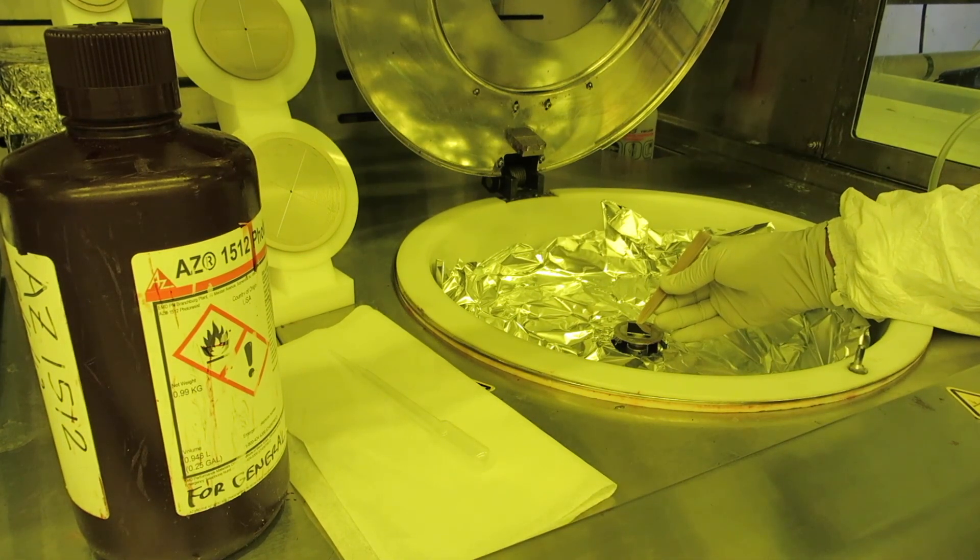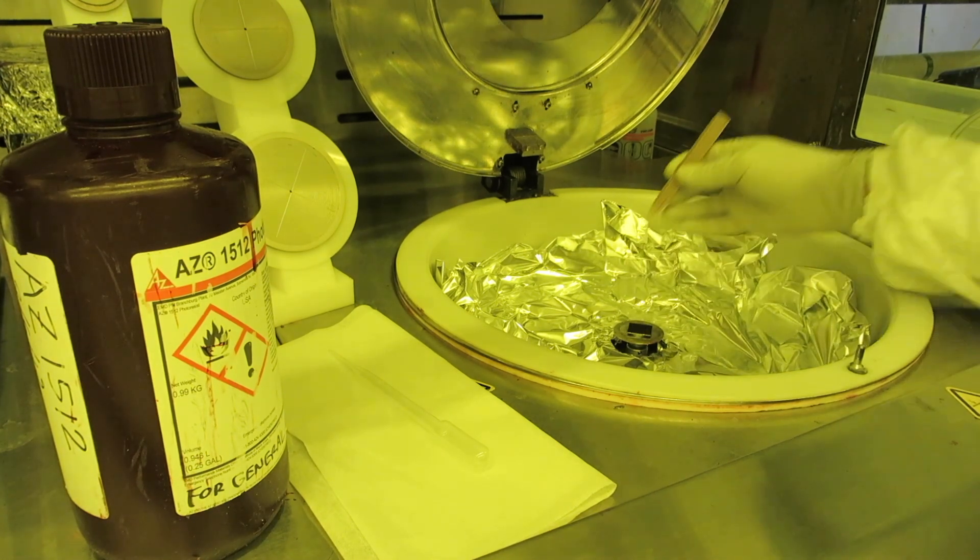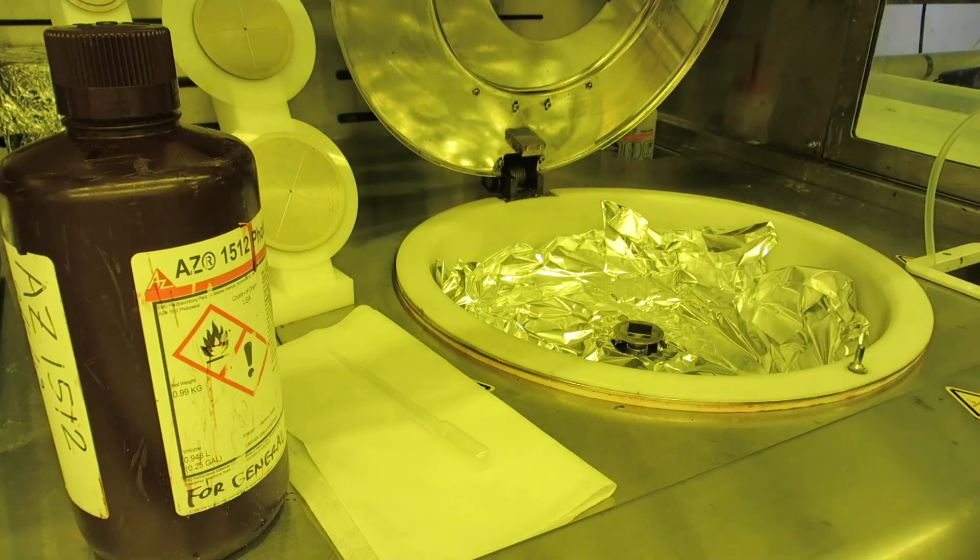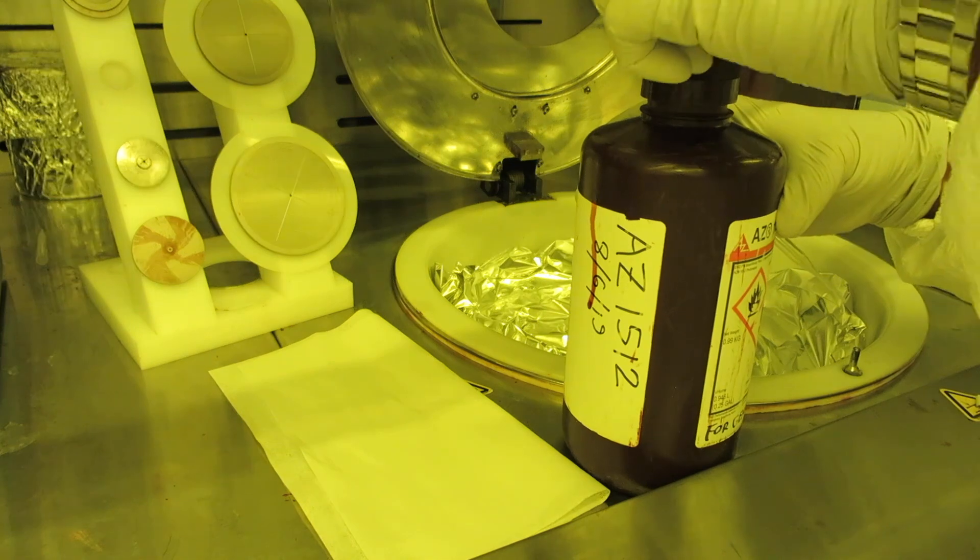Use your tweezers to scoot it around until it looks very well centered. If it's not well centered and it's sitting way off center, it's likely to go flying when you start spinning.